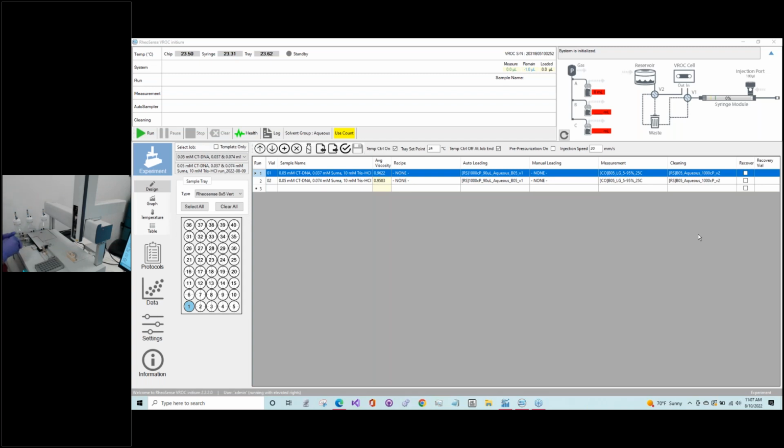Cool. Another thing I like to check is that there isn't any excess liquid from the back end cleaning of the syringe here. If there is some excess liquid, it could be that the piston is loose, and also you just make a mess, and we don't like messes. Another thing I like to check as well is to make sure there isn't any liquid around the cleaning ports here. That could also be indicative of something that needs to be changed or fixed with the ports.